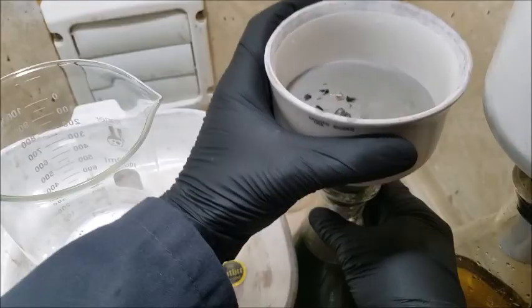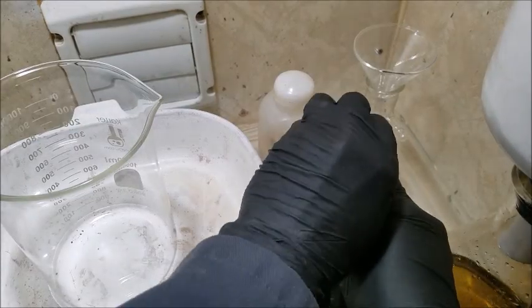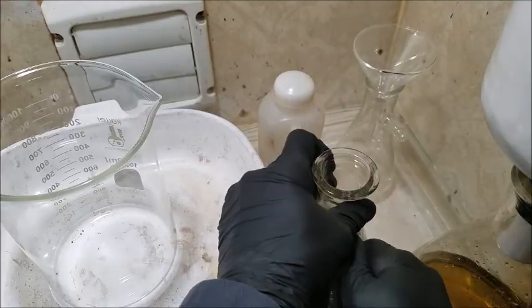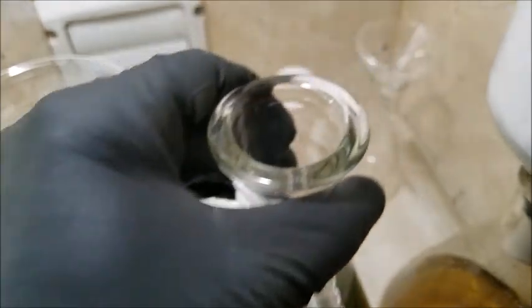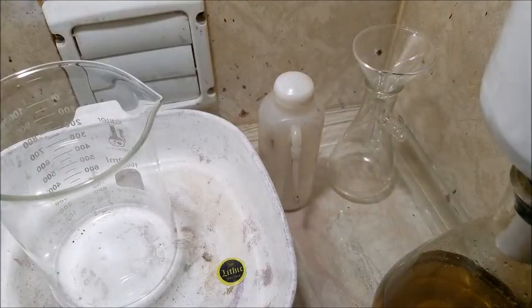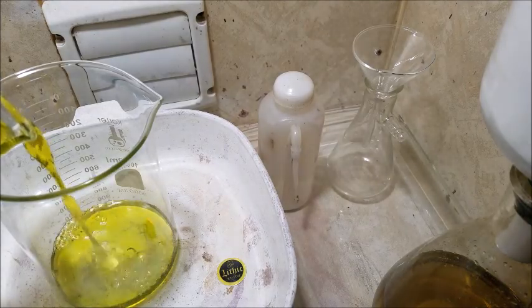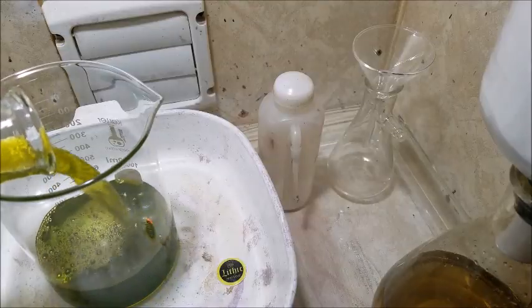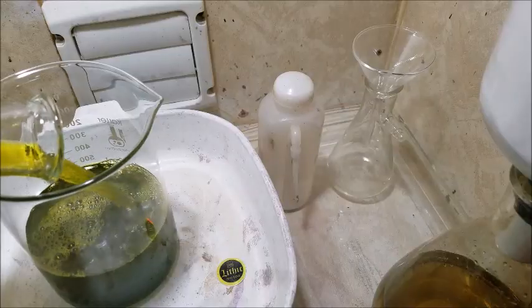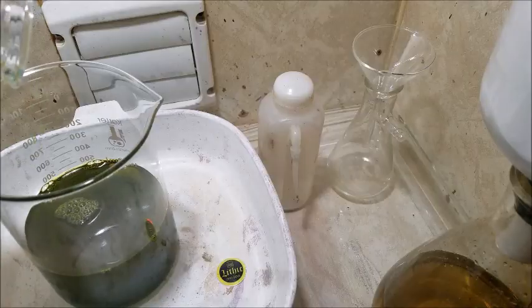I still have to rinse this out, but transfer this over for a minute here. I'm gonna empty out this vessel here. Stuff did not turn out quite the way I was hoping. I think we could filter it again, but I don't believe the results will be much different.